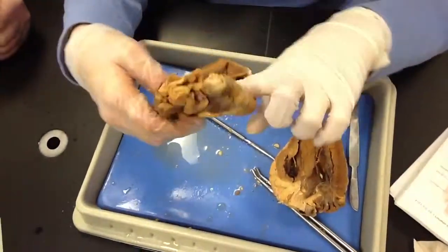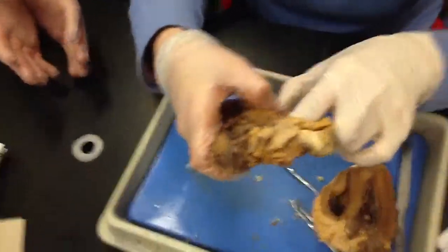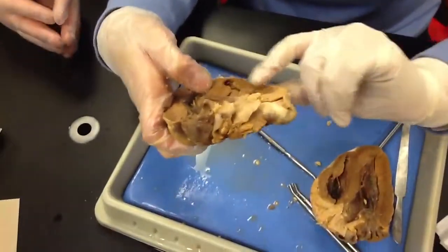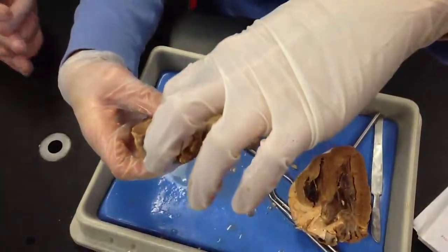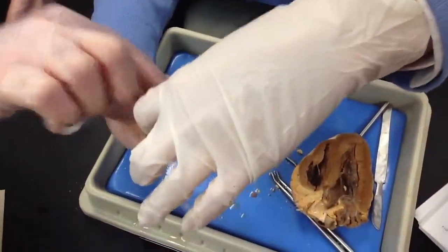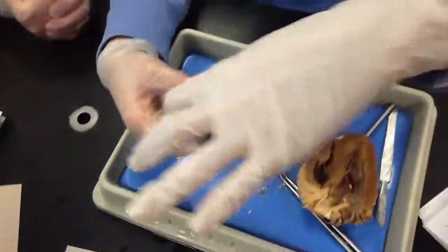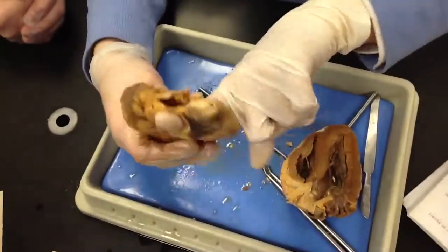Sorry, guys. Once again, the right side will be distinctively smaller and thinner because it's lower pressure. It's only receiving. Both of the atria are only receiving. The ventricles are your discharging chambers, where it needs its power, because this is pushing it to the rest of the body, to the aortic arch.